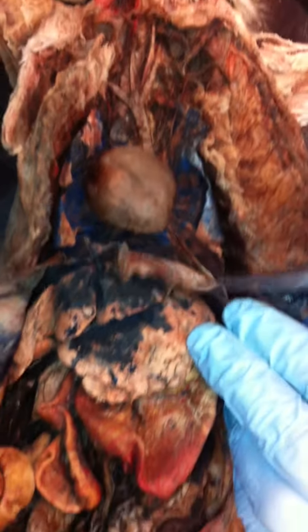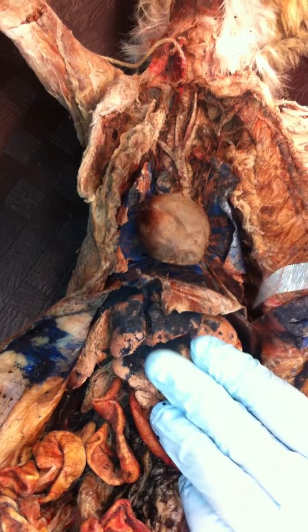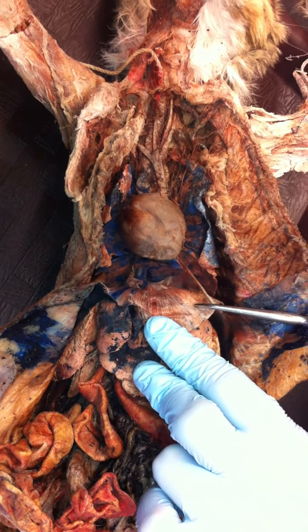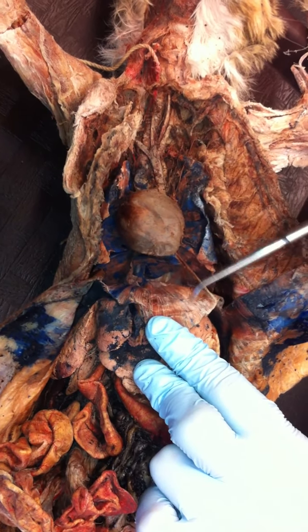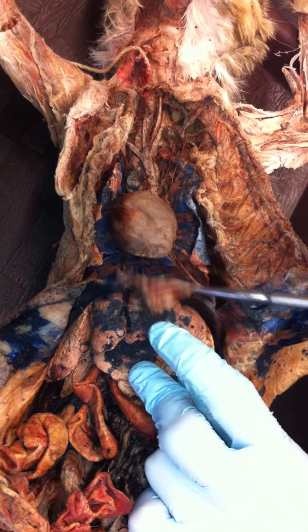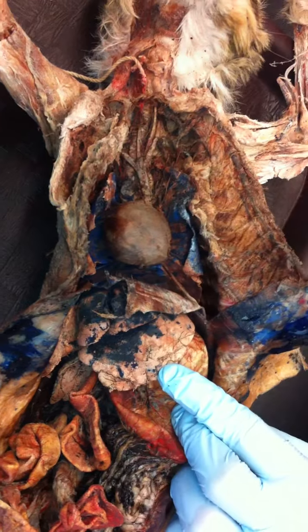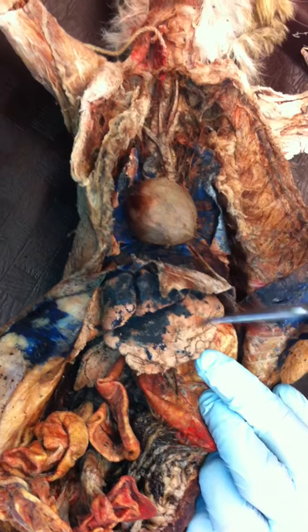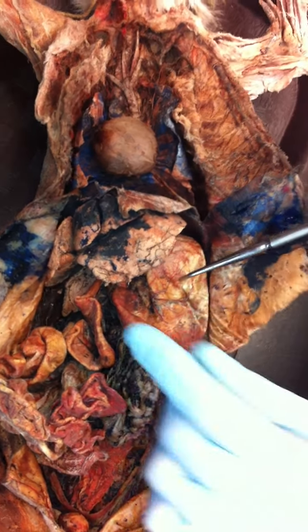Then if you look down here, you have this flap here that separates the lungs, the pleural cavity, from the rest, and this is the diaphragm. Okay? So see how it's muscle, so it's got these striations. Okay? And then the big, large thing you have on the right side, this is the liver. It's got multiple lobes. Okay? Beside it, the big flappy sac. This is your stomach. Okay?